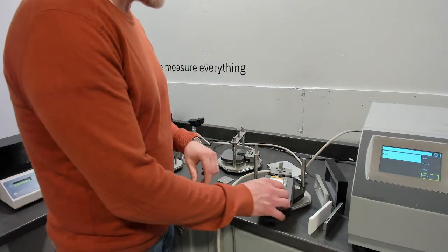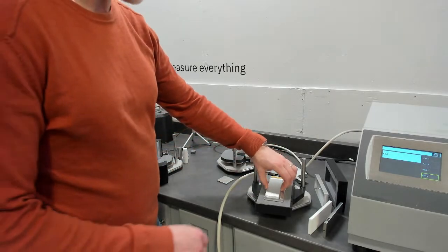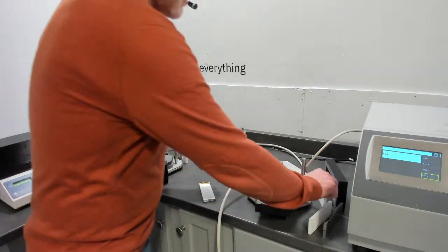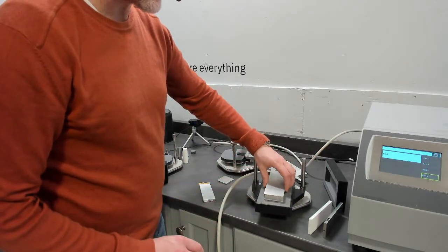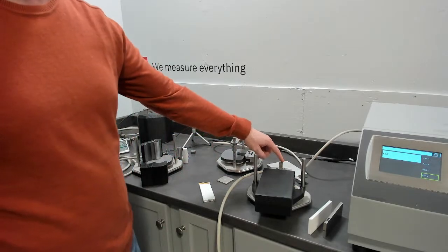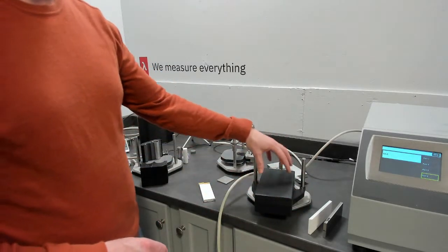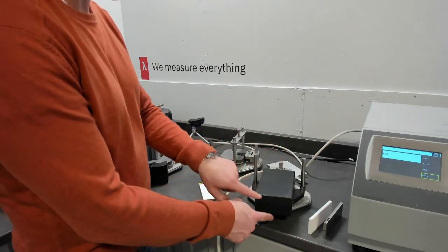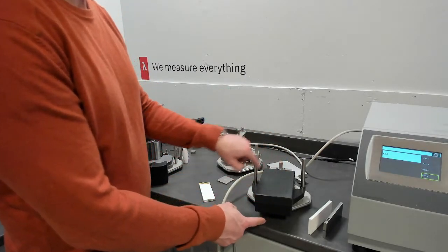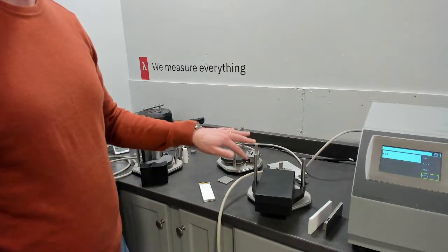So if we were measuring the specific heat of this pouch battery, we would run a reference. The reference would be empty, so no sample inside it. And this is configured inside of our room temperature sample holder. This of course could be put in the oven up to 75 Celsius, and then we have an upgrade of temperature on the insulation used that would allow that sensor to go up to 300 Celsius and down subambient as well.